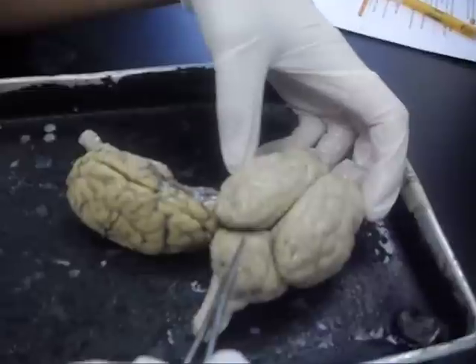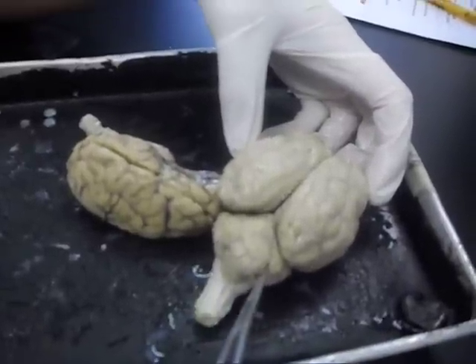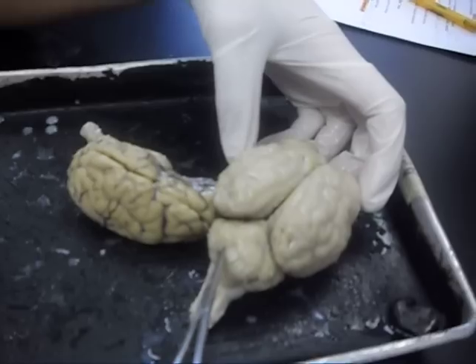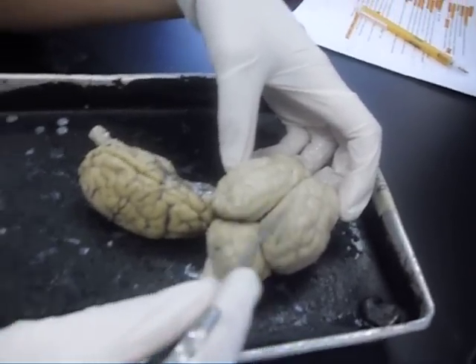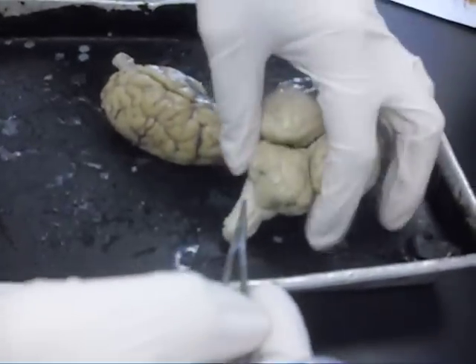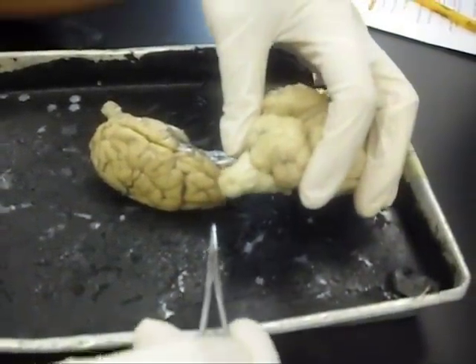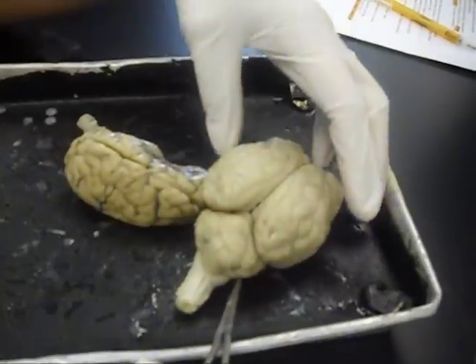What about the hemispheres on the other side? This is the cerebellum. This is the cerebrum. The vermis — the worm. The cerebellar cortex, also known as the folia.